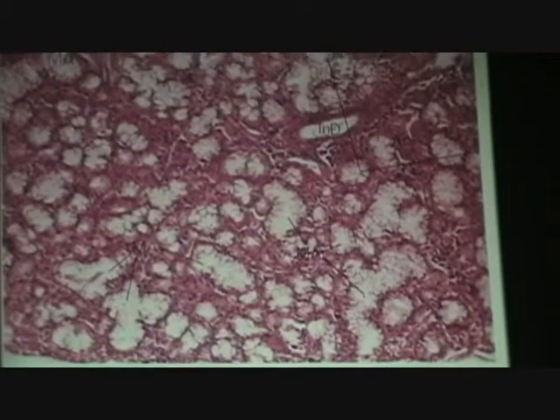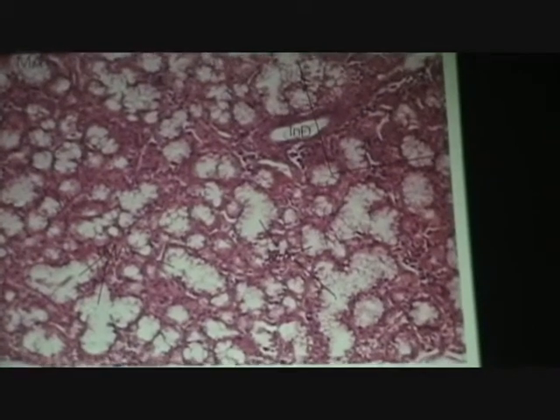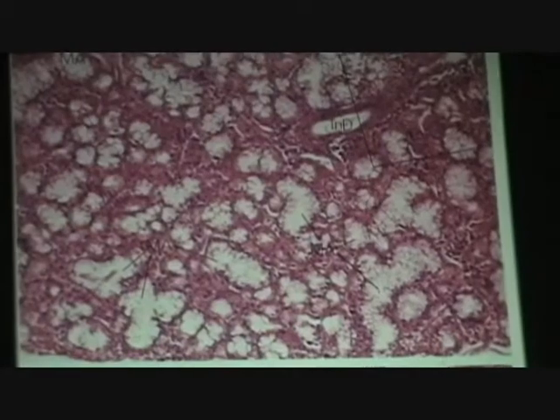At least half is mucus, which makes it sublingual for sure. Submandibular would have to have far, far less mucous cell cluster. But, you know, it's not as dominant as it was in the previous slide for sublingual. All right. On to the layers of the GI tract wall.